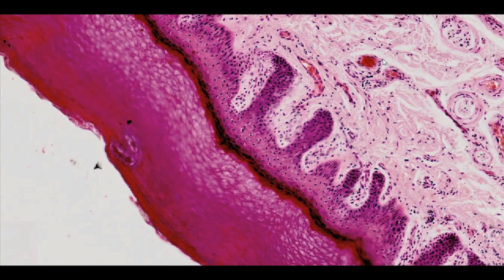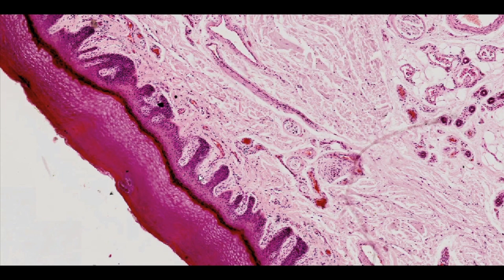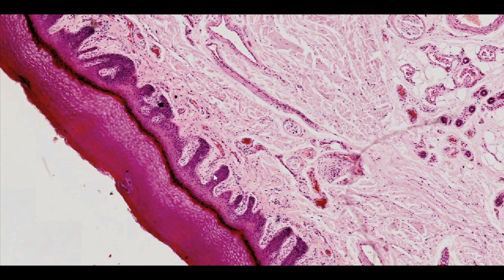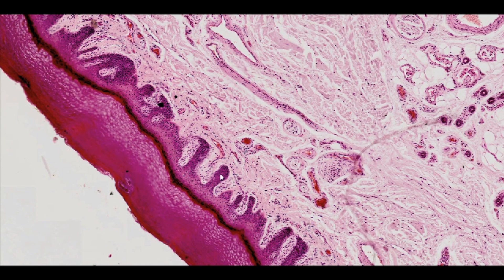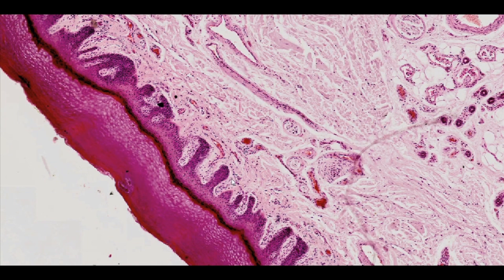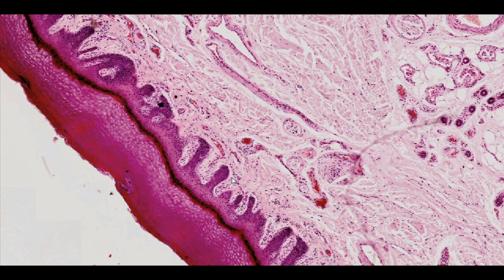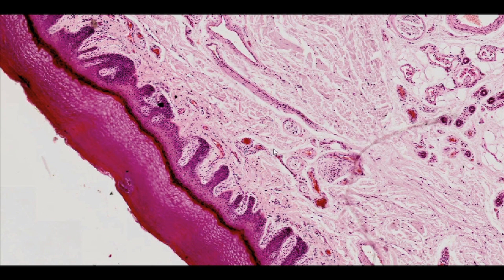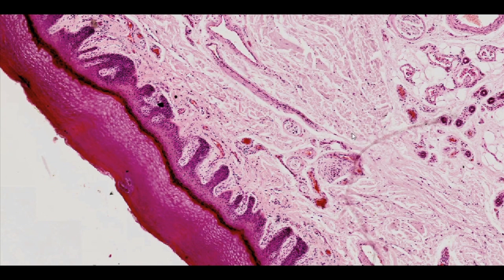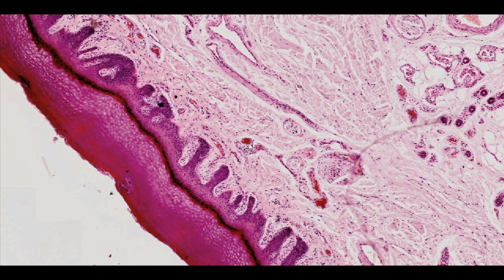Under the epidermis there is a layer of dermis which forms a tight connection with the epidermis, additionally strengthened by the epidermal projections into the dermis — the so-called epidermal icicles — and dermal papillae. Histologically, the dermis is a typical connective tissue proper, rich in cells, collagen, and elastic fibers, as well as blood vessels and multiple nerve fibers in the form of nerve trunks and tactile corpuscles.